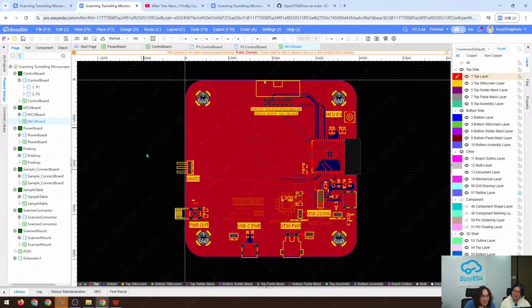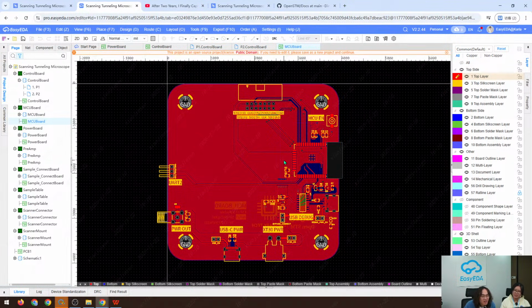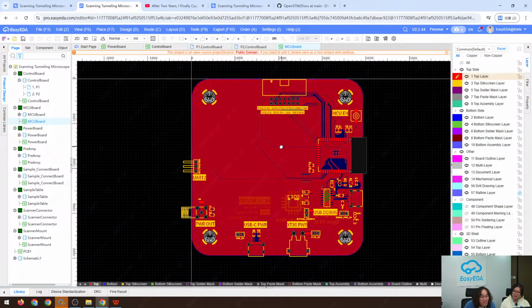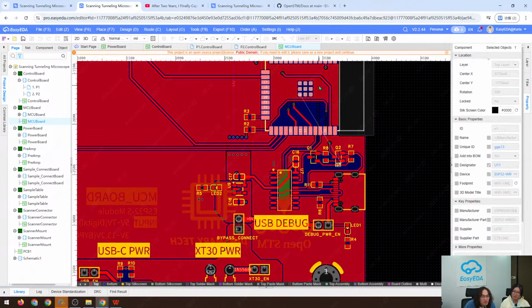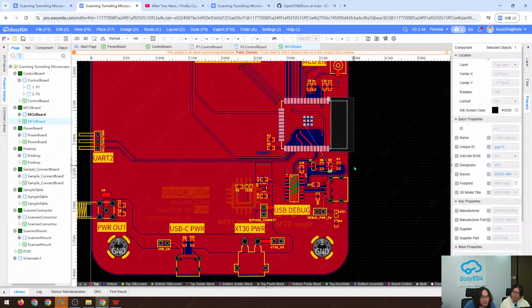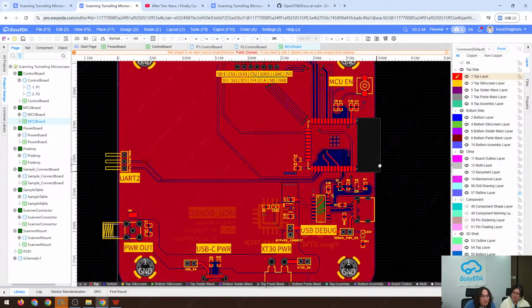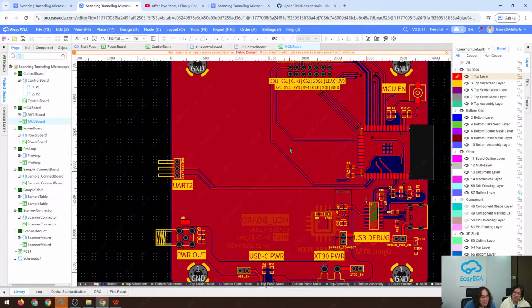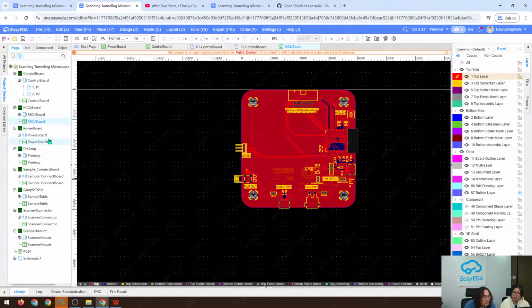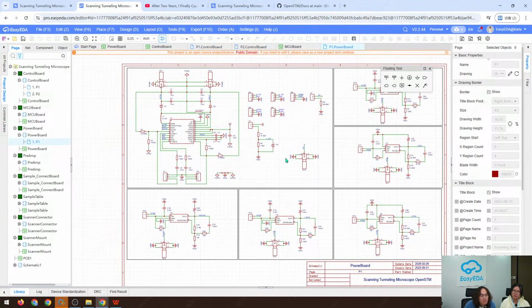So the MCU board is basically like a development board, an ESP32 development board. This is the ESP32 module, and this is the USB to UART chip. Yeah, this is very simple. And the power board, which we will introduce in detail in today's live stream.